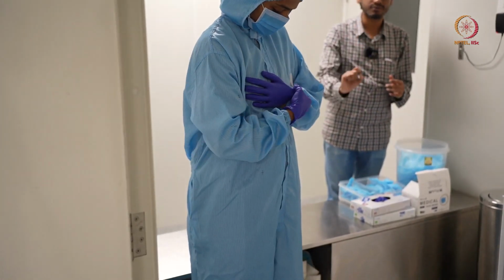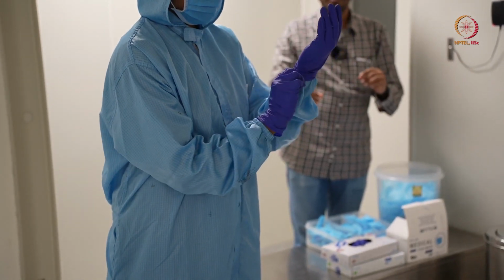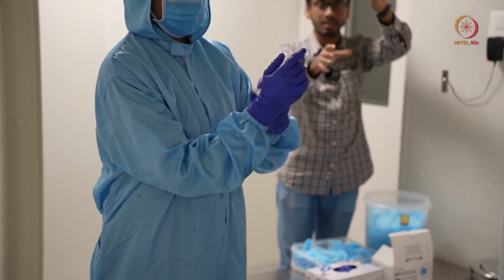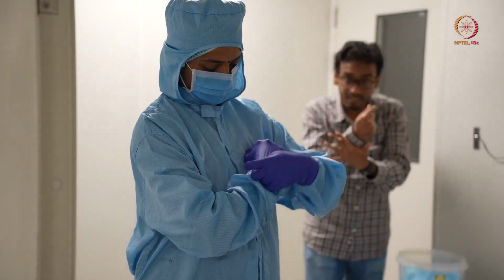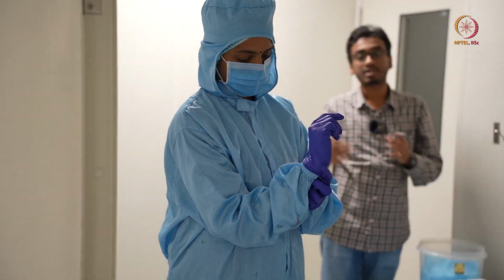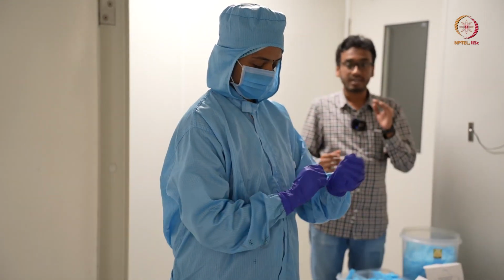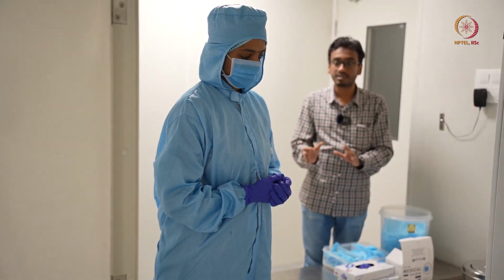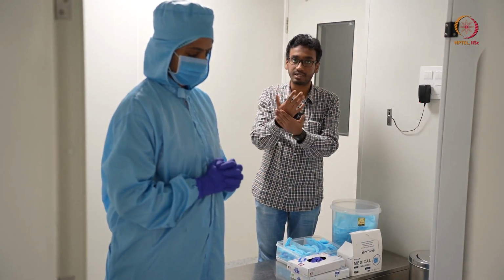And there is a particular way of wearing the gloves that she is showing now. You can see there. So gloves should be on top of the gown or that cuff. Cuff will go inside and gloves will come out of that. Why is it so? This is because if any dust particle or any contamination generated by your skin or by you basically, that should not fall in the clean room. So it will be contained in gloves in this way. If you wear gloves in this way, it will come through the cuff and it will fall inside the gloves.